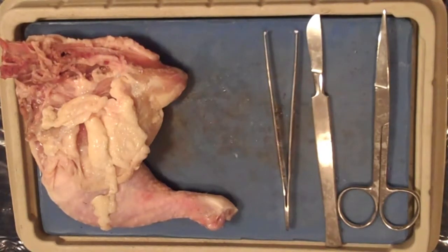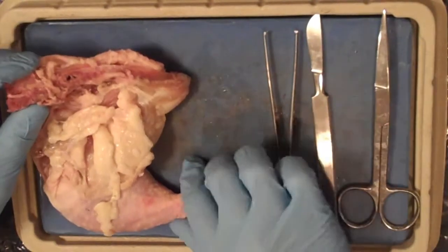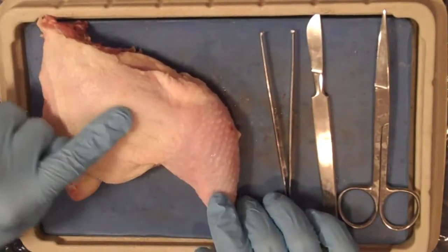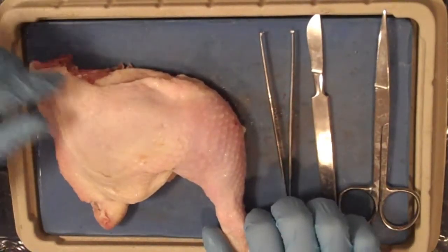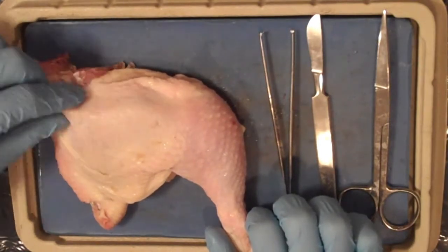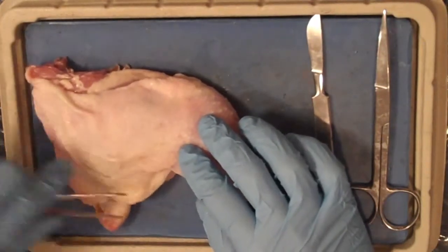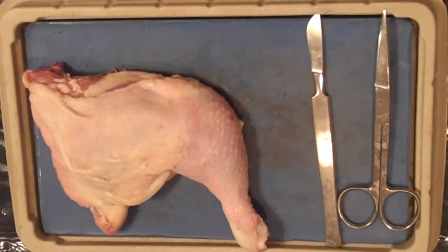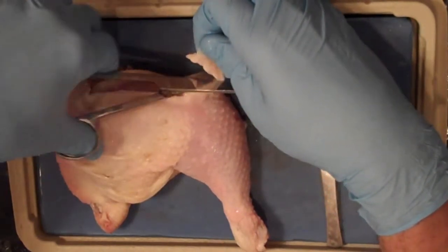The first tissue we will be observing is epithelial tissue. Epithelial tissue is one of the four main types of tissues. There are many types of epithelial tissues that are defined by shape and number of layers. The type of epithelial tissue that makes up the surface of our skin, or chicken skin, is the epidermis, and its stratified squamous epithelium, consisting of many layers of flat cells. They are firm but stretchy, protecting the organs from the environment while also being elastic and resistant to impact. Notice that I pull and stretch the epithelium in a number of locations. Use your scissors to remove a piece of epithelial tissue so that you can see it underneath the microscope.